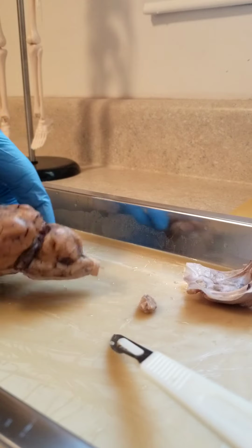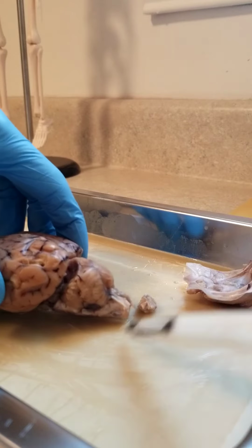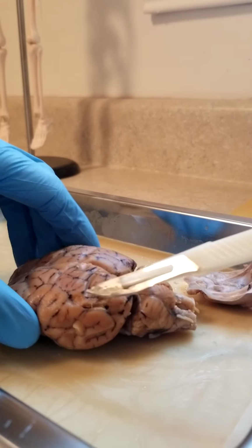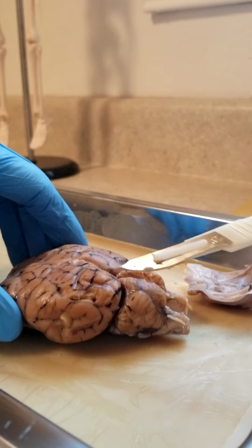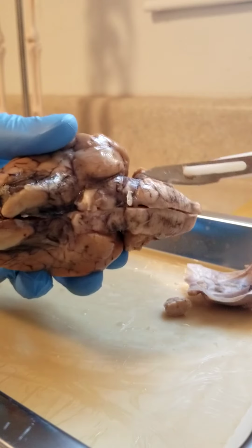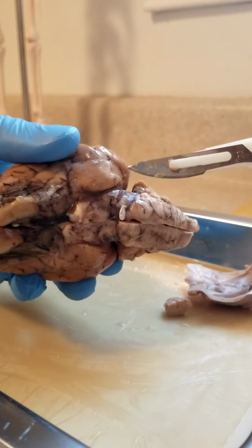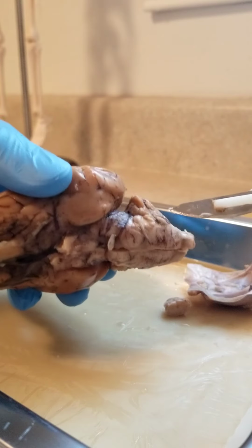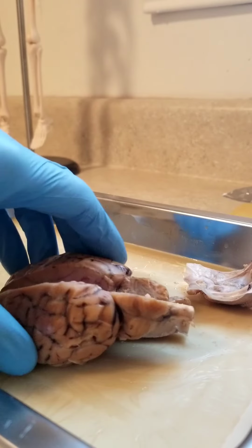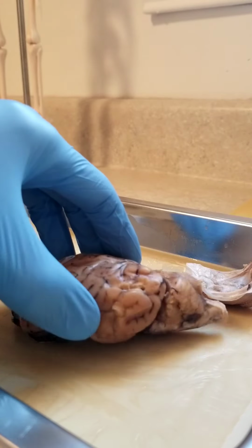We'll start with the outside here on the meninges. The dura mater is the outside protective sheet there. The arachnoid is actually the same kind of protective layer. It's that shiny area on the outside. There's also the pia mater. That kind of covers the whole meninges area there.